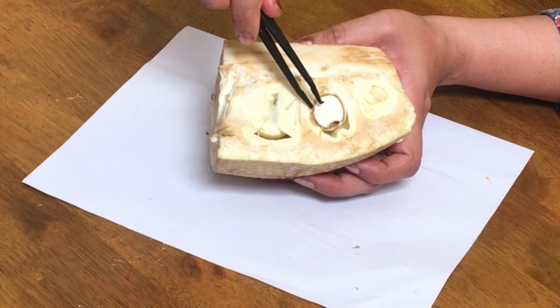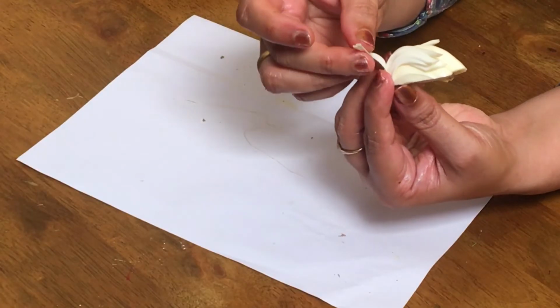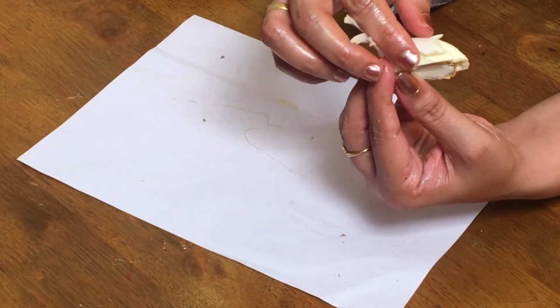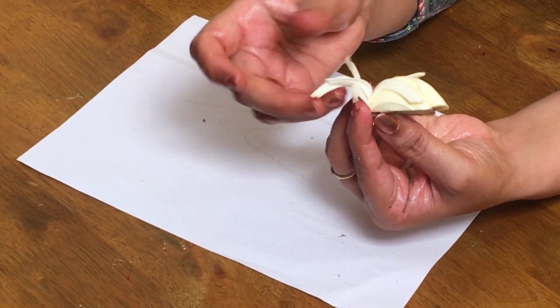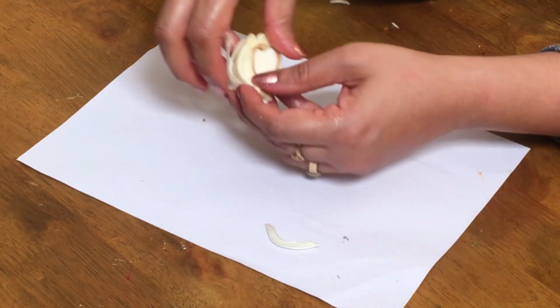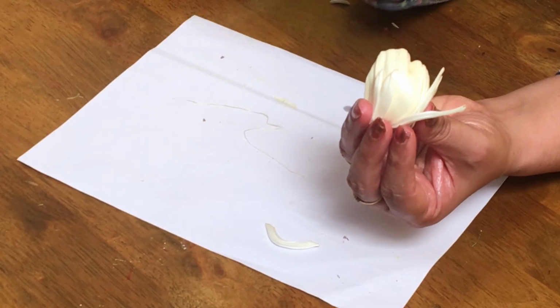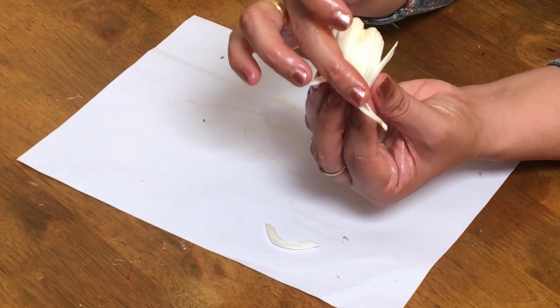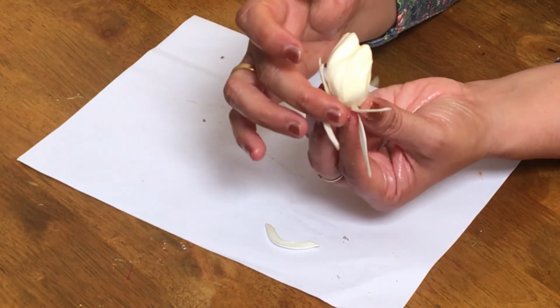Okay, and inside the perianth you will be able to find the seeds. So this is a seed. These structures, which again we don't eat, which surround the fruit of jackfruit, are the sepals and bract of the flower. So this is how a jackfruit looks. Once it is ripened, this part completely turns yellow or orange, and these non-edible structures are the bract of the flower.